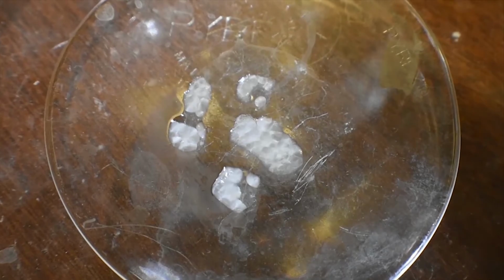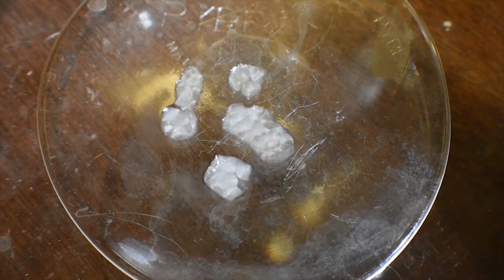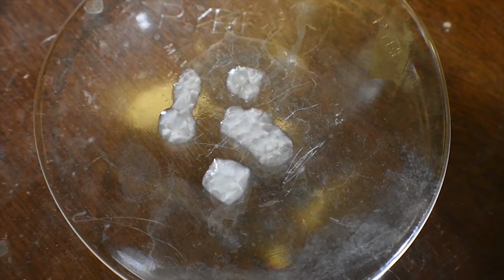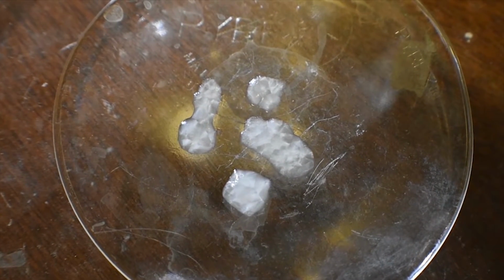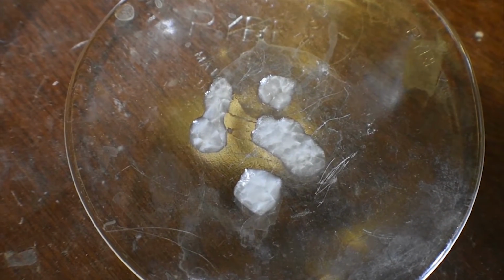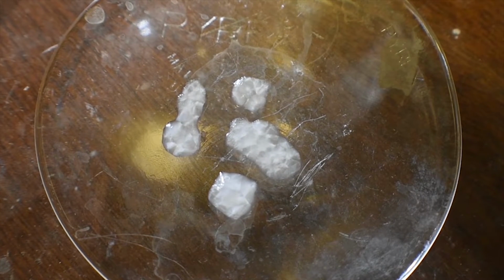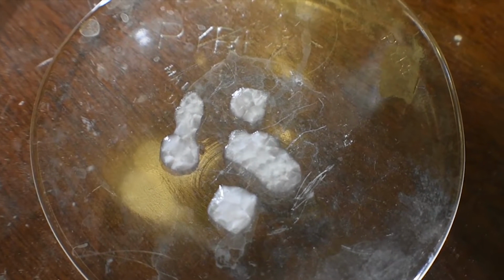Let me get a little bit closer, and you should be able to see that pretty much everything has crystallized, and that is the rhodizonic acid, because basically what we have in the beaker is a super concentrated solution of, almost completely actually, rhodizonic acid with a tiny bit of nitric acid and maybe some water. And so when I put it on a cool surface such as this watch glass, it's almost certain that it's going to crystallize out or precipitate. So yeah, that's pretty cool.